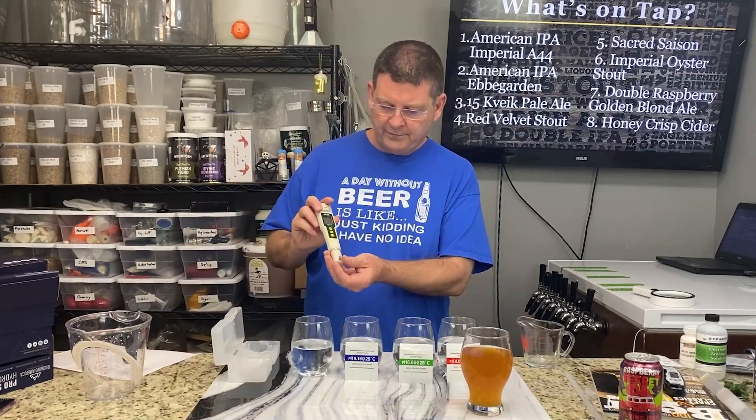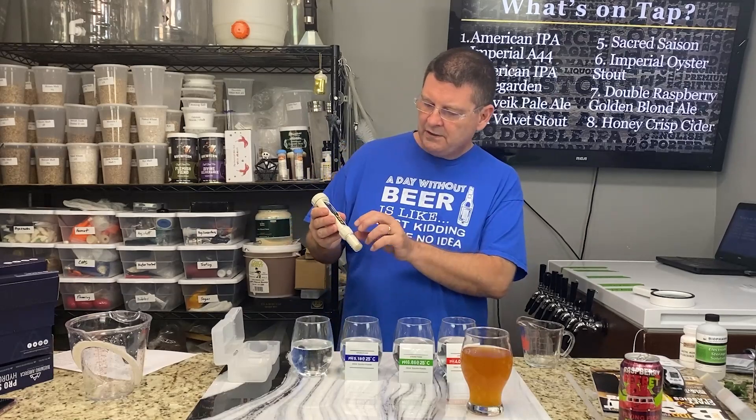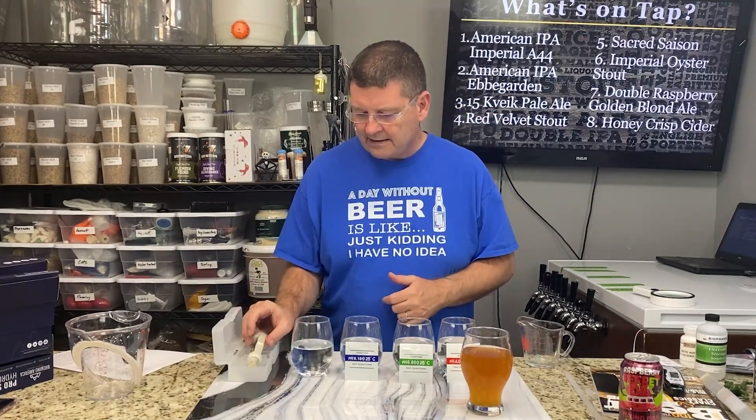The probe is right here and it's very easy. Also, if you want to change between Fahrenheit and Celsius, I'll show you — let me move the camera so you can see better what I'm doing.